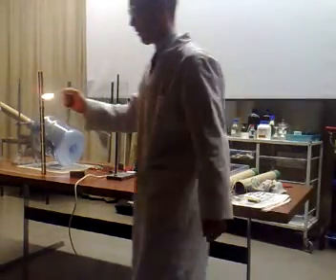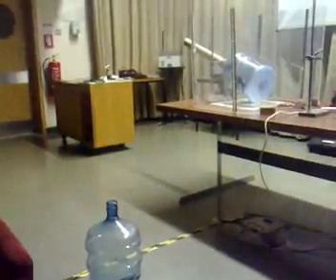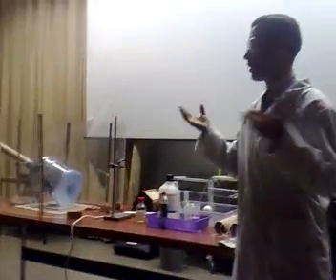You're bored. Yes, go for it. Lights, please. Lights. Do you see why I don't put it in? Do you see why I don't?